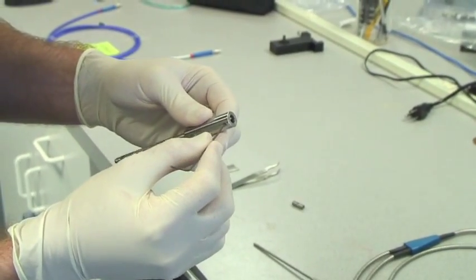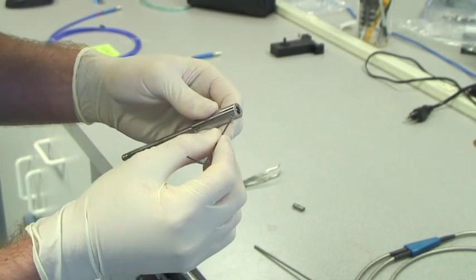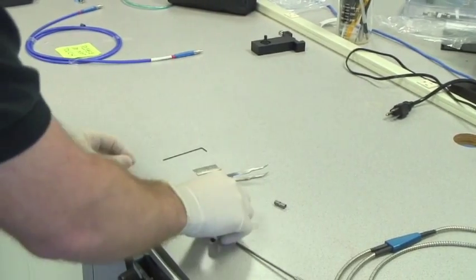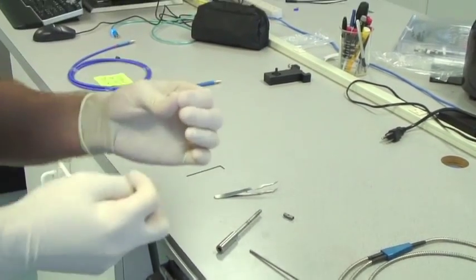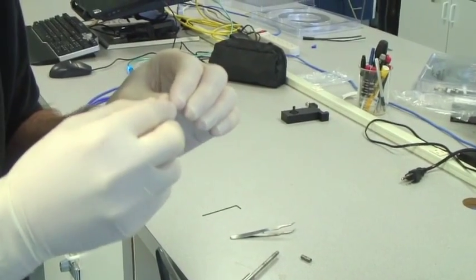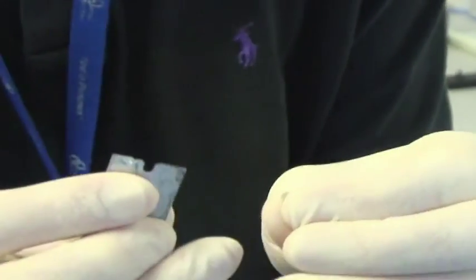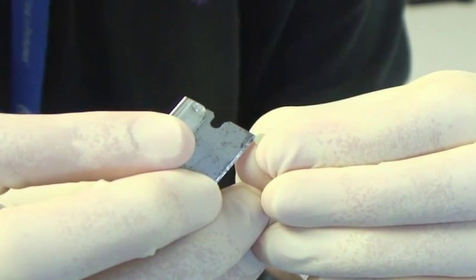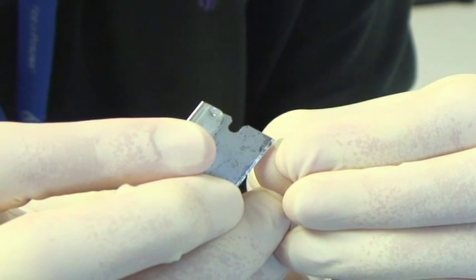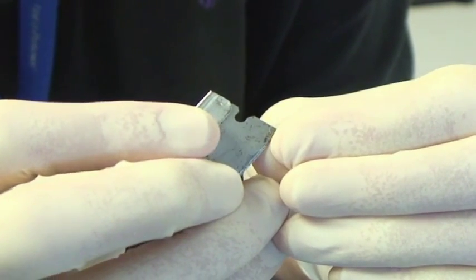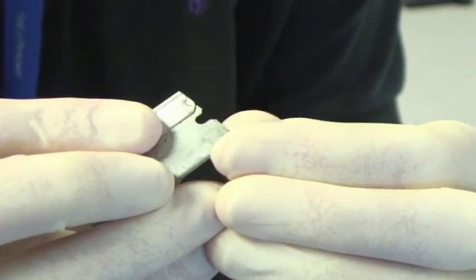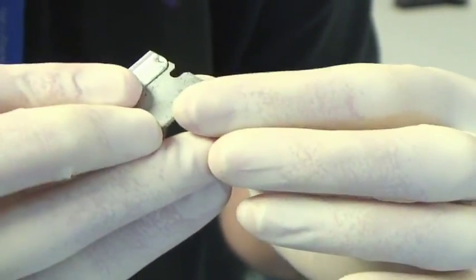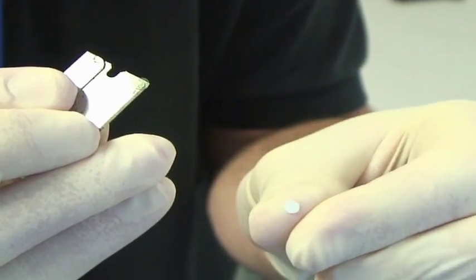Taking our pH patch, we're going to separate this. I'll do what I can to get up close here. Using a razor blade, it can be difficult to just get right in there, and it separates into the two pieces.